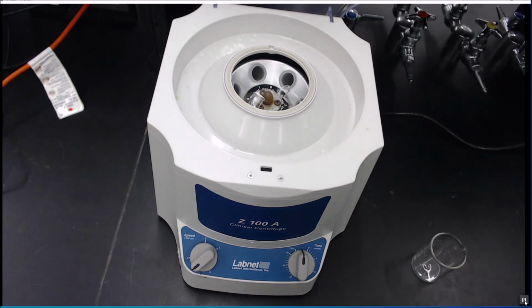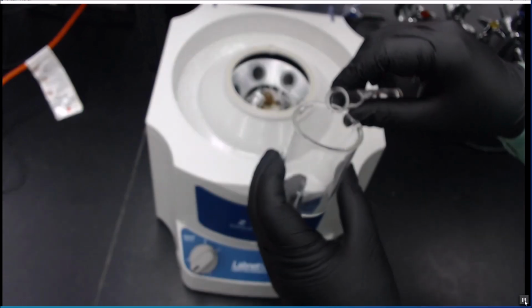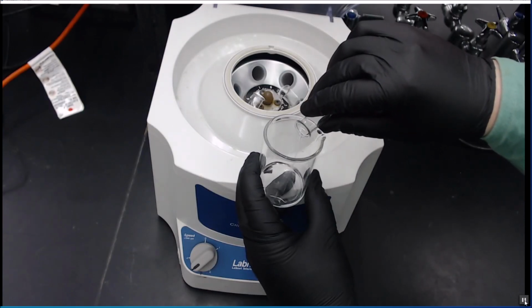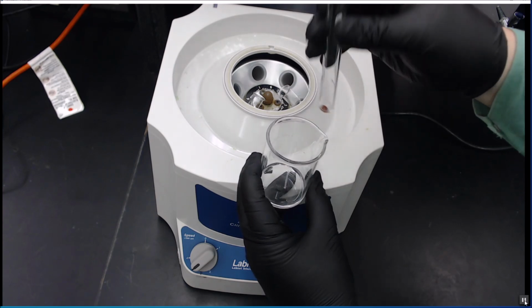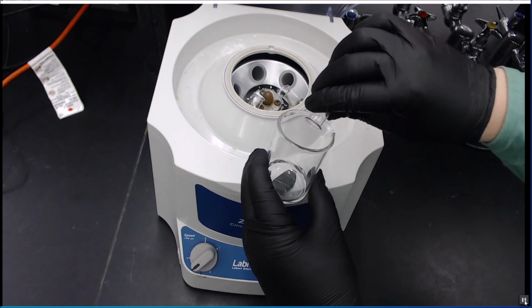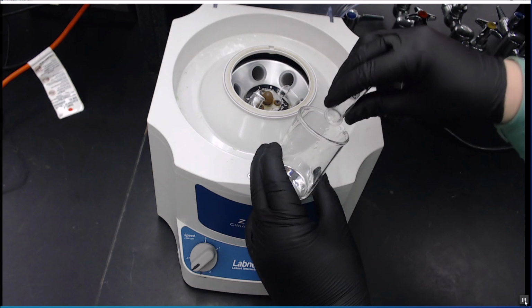So, now we have our beaker, and I'm doing this in the air so you can see it. Please don't do it like this. Do it on the bench, and especially don't do it over the equipment. This is an acidic solution, and you just very carefully, very gently pour off that liquid. Water, of course, has a lot of surface tension, so it might require gentle coaxing.